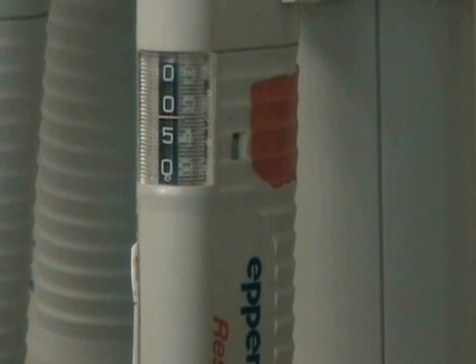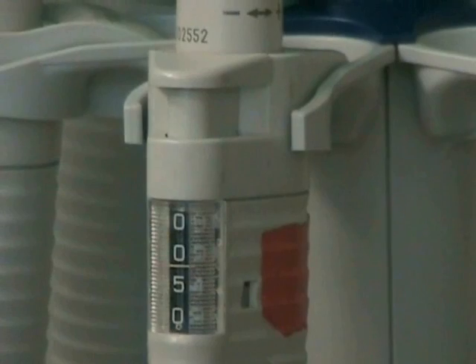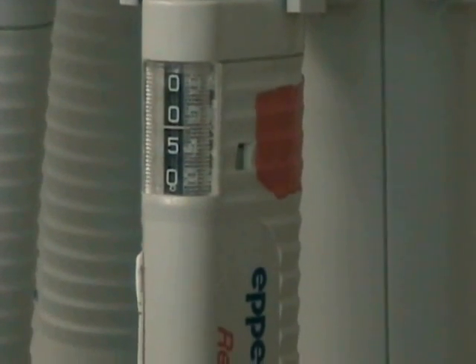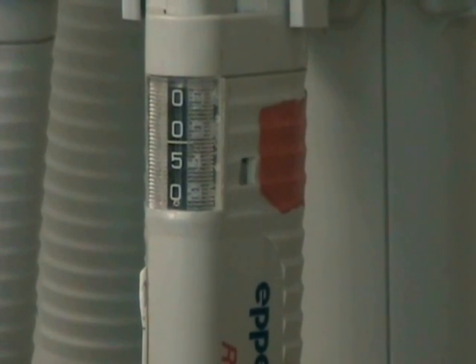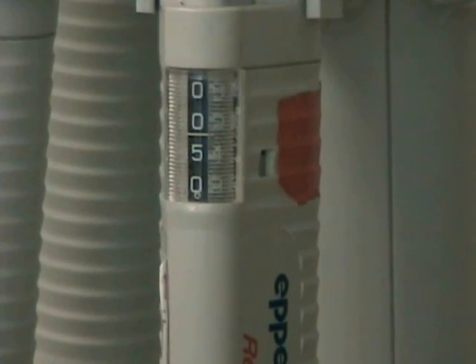Now the range that you've seen - this pipette can do from 10 microliters to 0.5 microliters. It's very important not to exceed these ranges because you can very easily damage the mechanism and the pipette becomes imprecise or useless. Each of these units is worth at least $300.